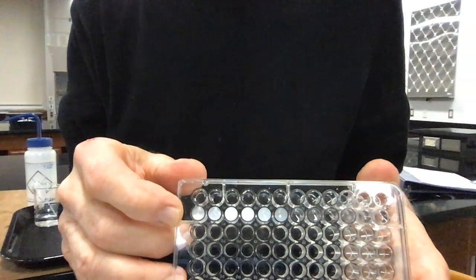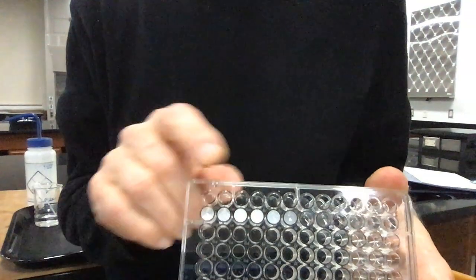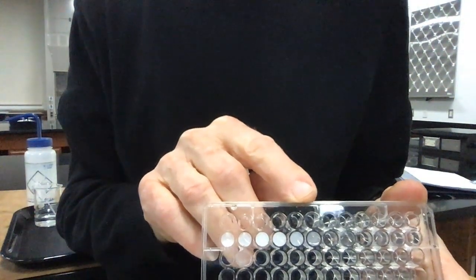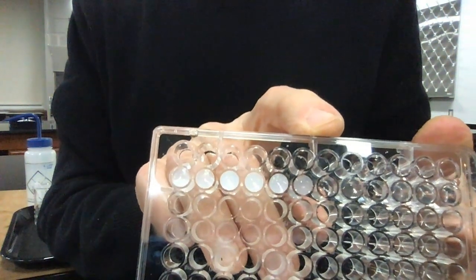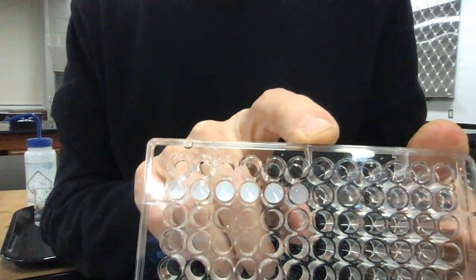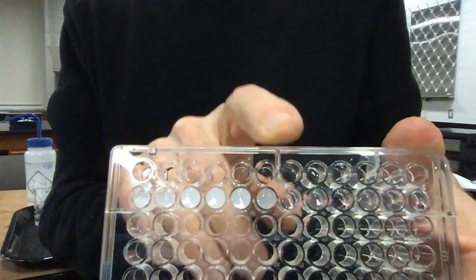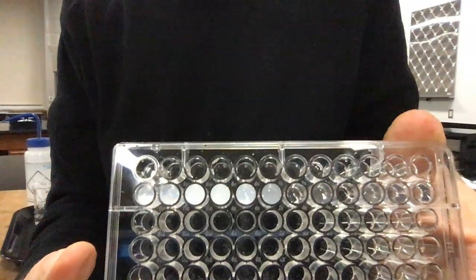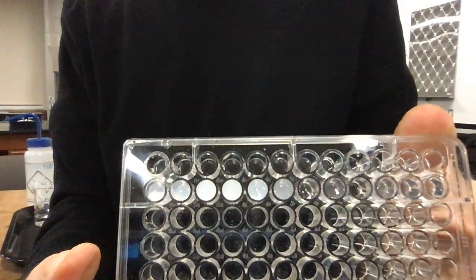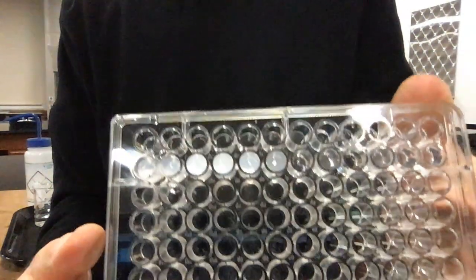is formed in the first approximately 5 wells, and down in this well here it starts to fade out, and it's imperceptible almost in the next well here. It's hard to see anything. Now, what's important here is that you take note that we are in well 6, where the solution stops, forms a precipitate, but the next one, there's no precipitate. That's an important piece of data. So write down well 6 is the last one to form precipitate.